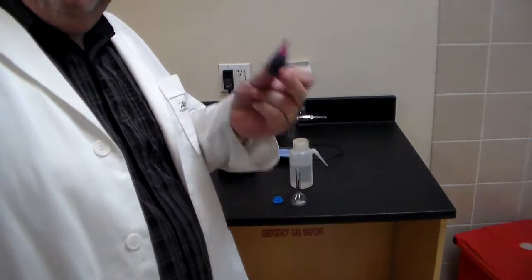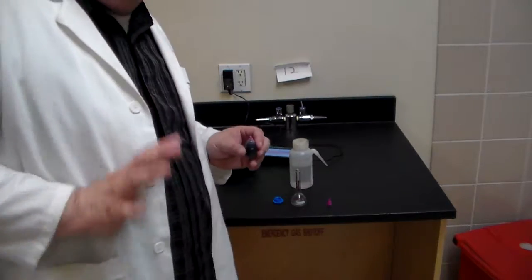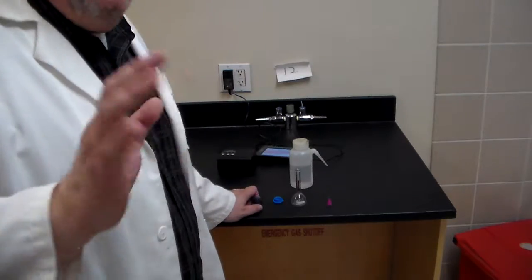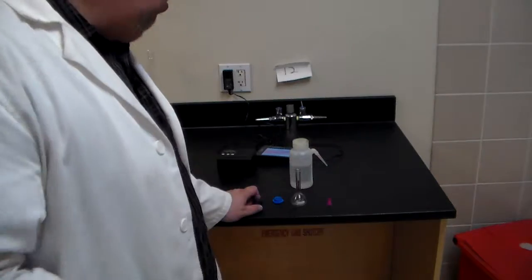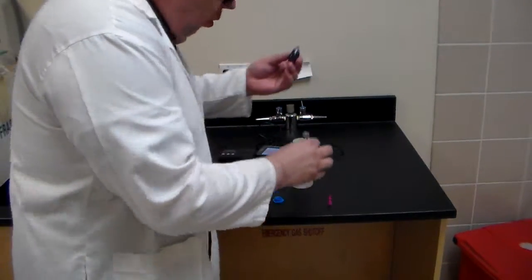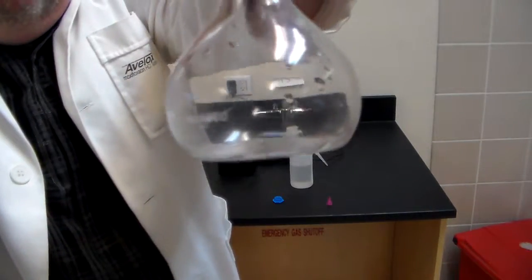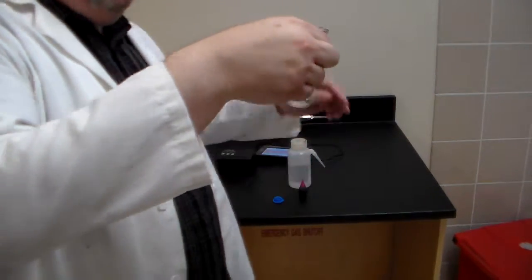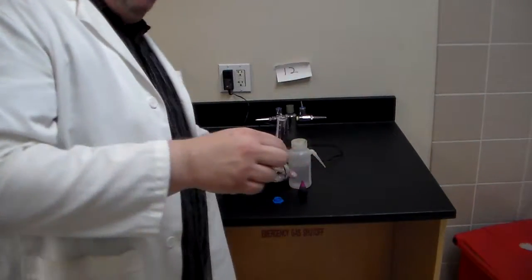Now, here I have food coloring. At this point, the concentration of the food coloring is really, really tiny, and I may just give it a value to start with so that it's easier for us to work with. But the idea is we're diluting. So we're going to take one drop, and we're going to put one drop in the flask. Okay, so we have our one drop in the flask, and you kind of notice, oh, look, it's got the purple stuff in there. Well, it was around Easter.